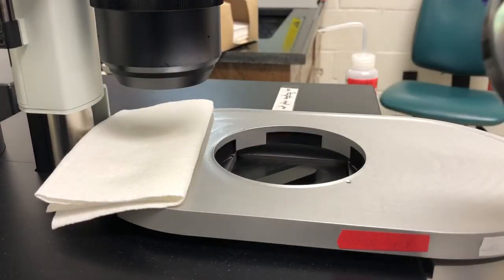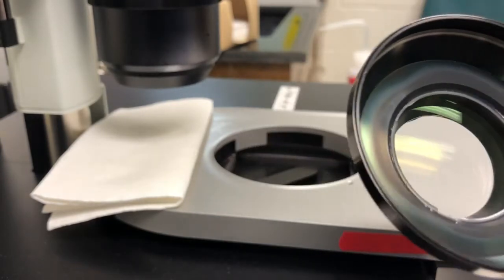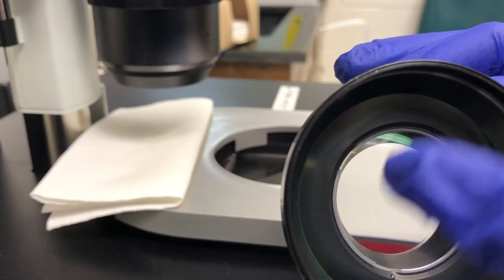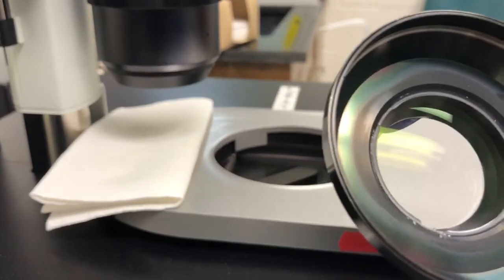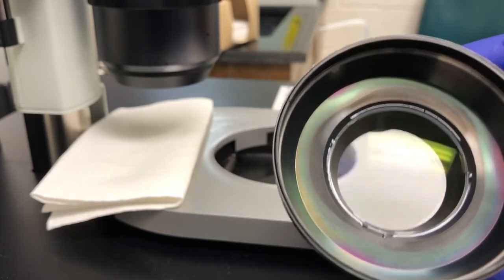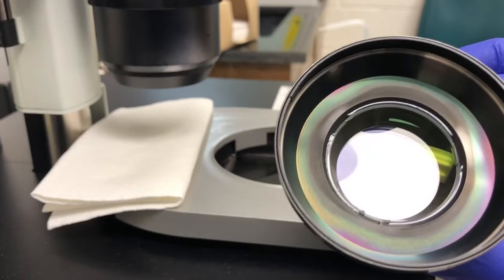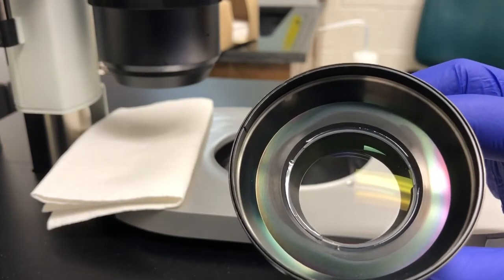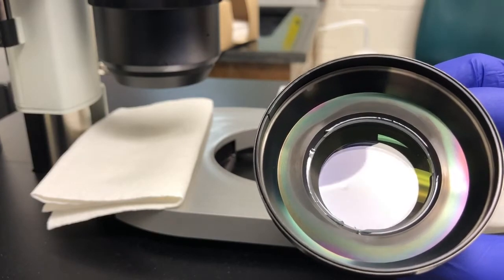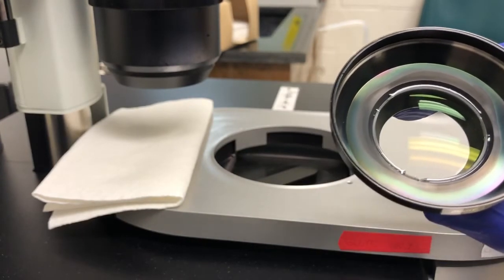The idea is if this is in good condition, we should see no fluid inside in here, in the sealed area. If there is fluid inside there, we need to contact LaVision to get a replacement cap. Why fluid gets in there is unclear. My guess is that the combination of dibenzyl ether or the ethanol that we use to clean weakens the glue, and then stuff starts getting in there. Whatever the reason, we can't have fluid in there, so if we do, we need to correct that.